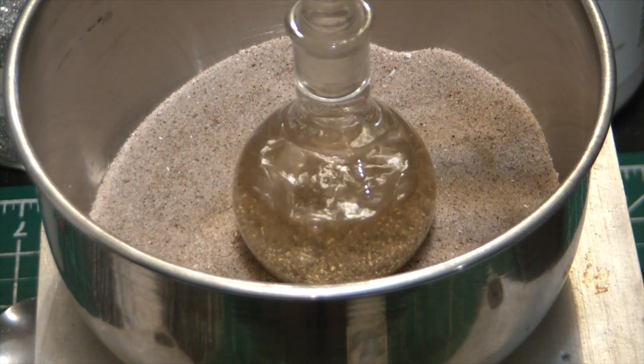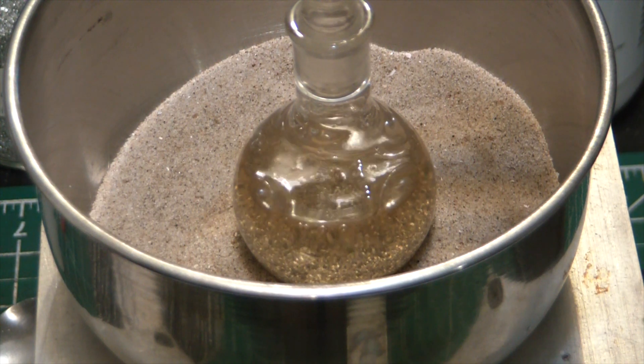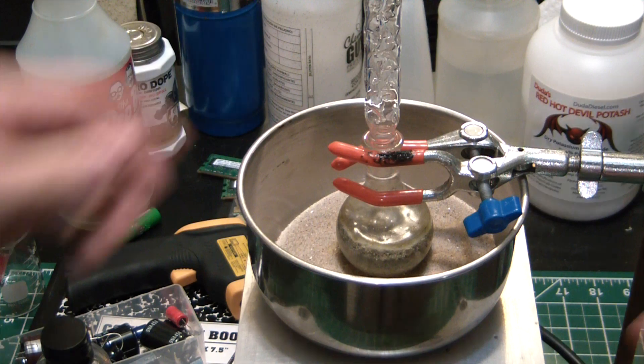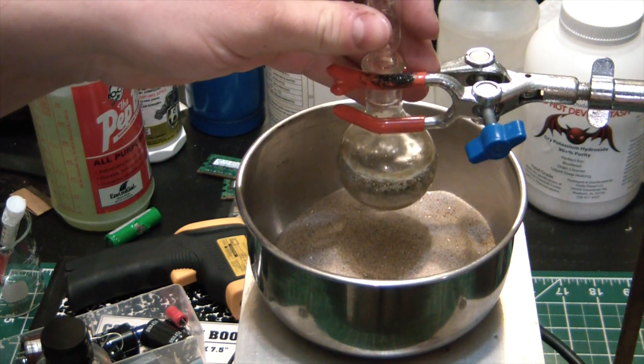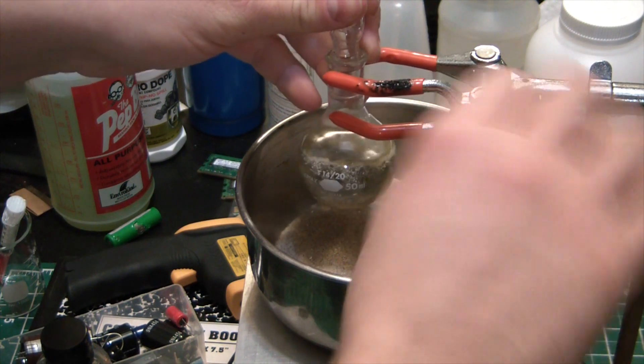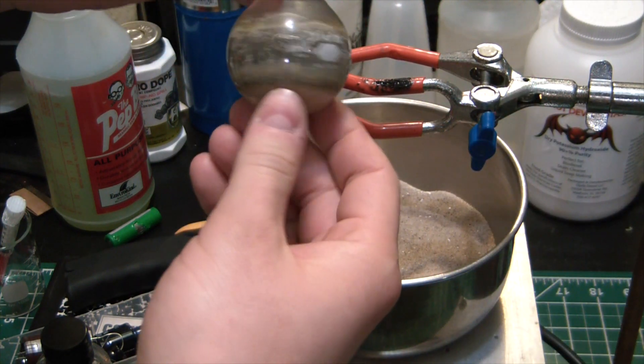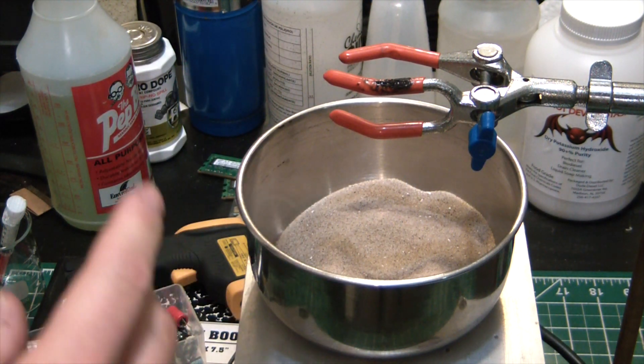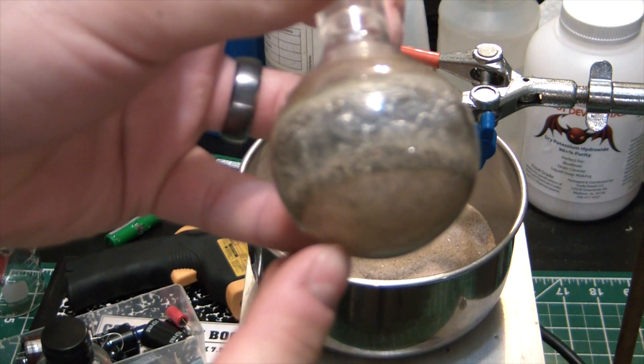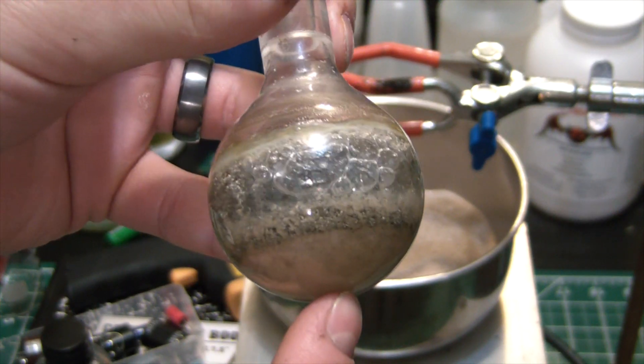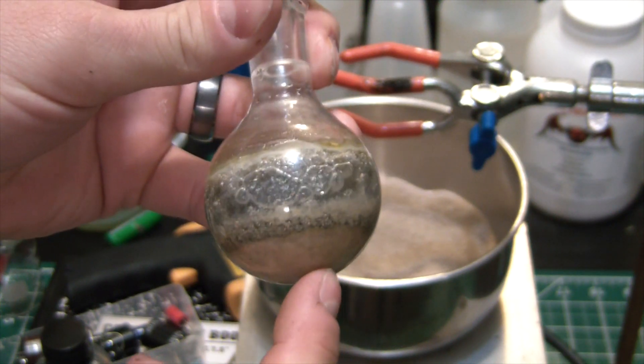So we should maybe be forming magnesium oxide now. Well it's been about 8 hours and sadly we have a failed reaction. Holding out hope that it would eventually work, but we're just not getting any reaction going on. Now you can see the potassium hydroxide all settled out to the bottom, so that could be part of what was the issue.